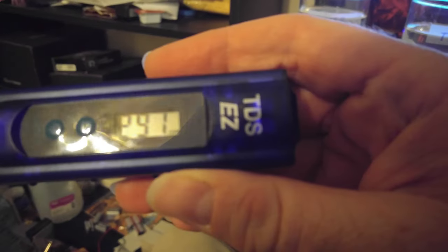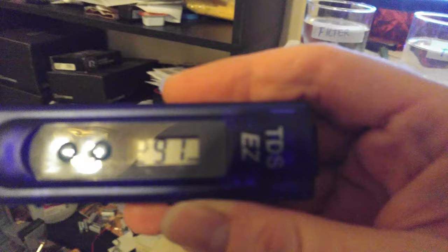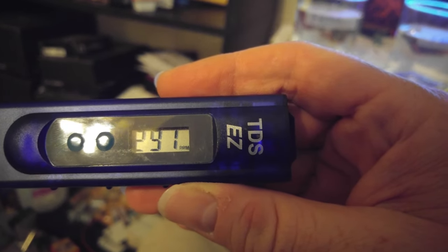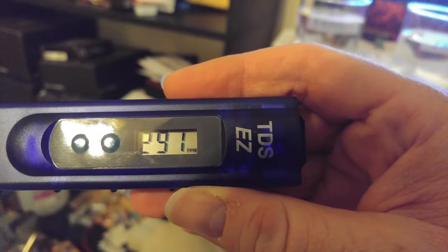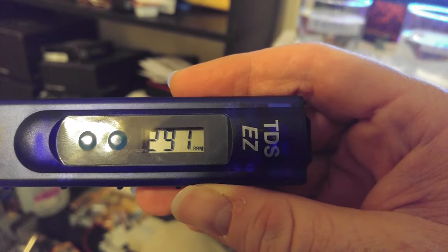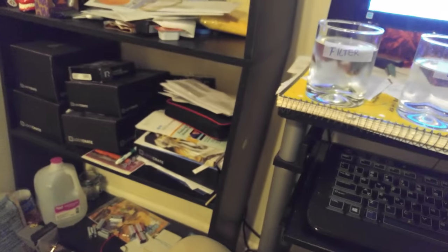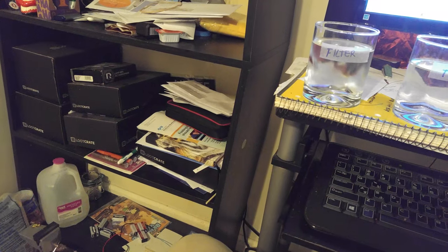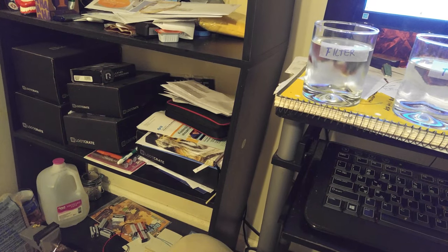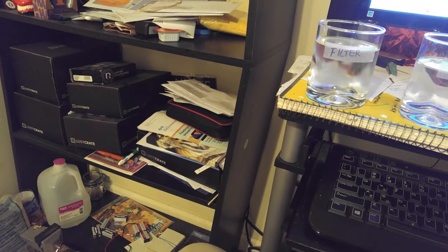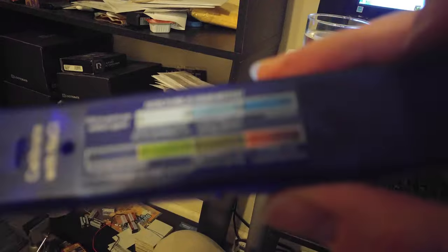You can see the tap water says 297, 291. See that? Alright, clear that. You can see the back right here.